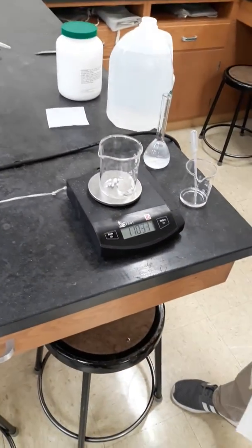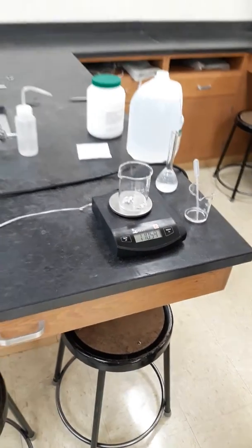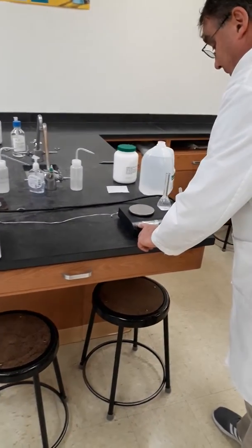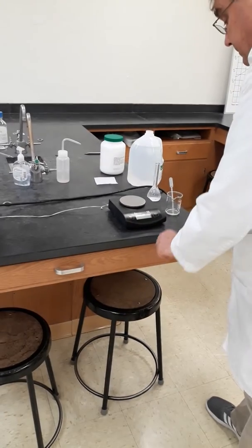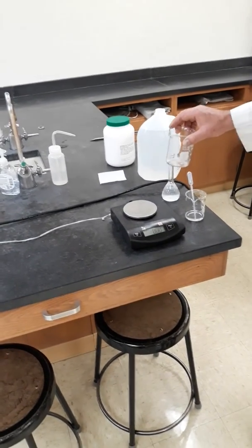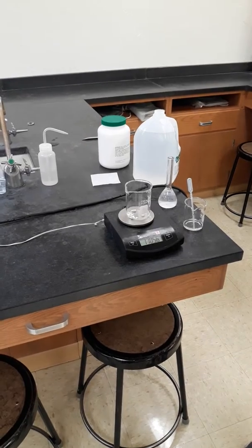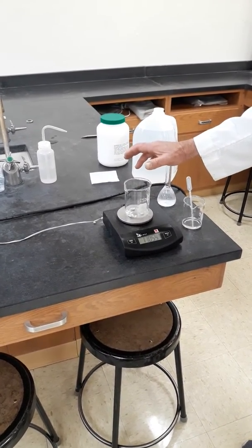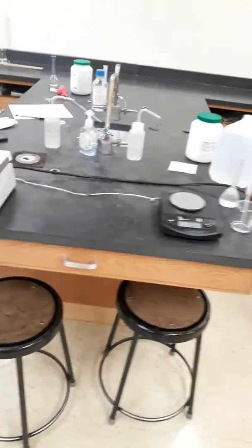Put it on the scale. 110 point, oh my goodness, okay. I'm going to turn this off. Turn it back on. 110.55. Pause.